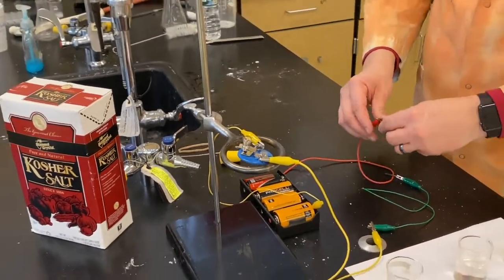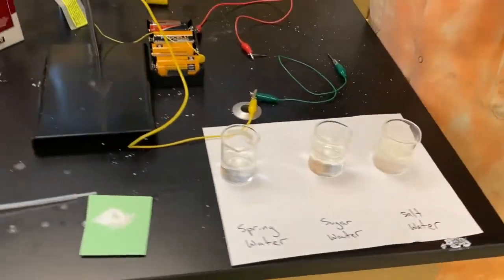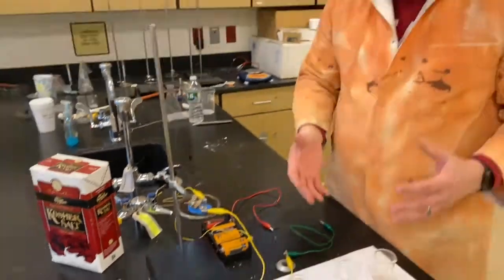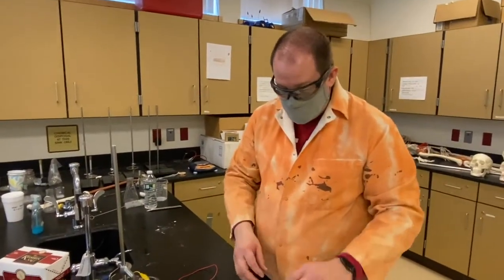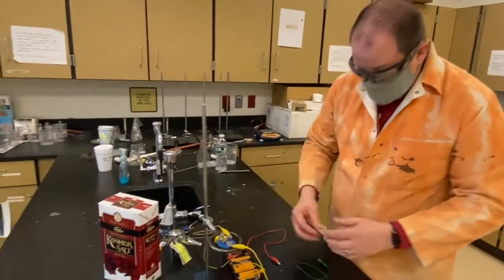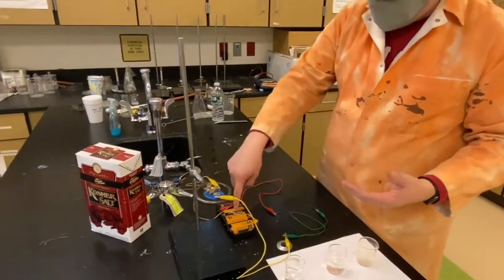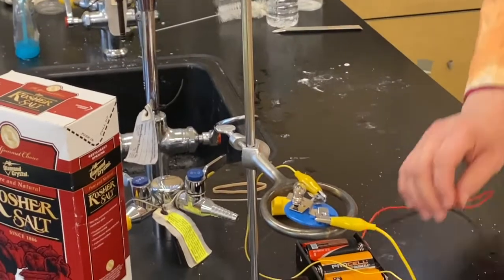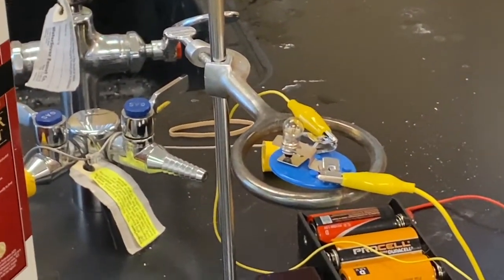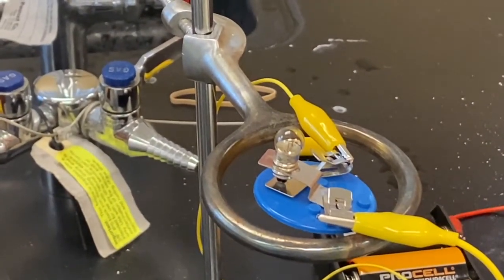So now we're going to go ahead and go to our next sample. Sugar, a molecular compound. One of the properties it has is it can break down to dissolve, similar to how salt does. It's allowing a lot of space between those molecules so we don't see the sugar anymore. Let's see now, does it have the ability to transport power through its medium for our light? We put our two probes in, get them as close together as we can. And once again, we're not seeing any kind of change with our light bulb.